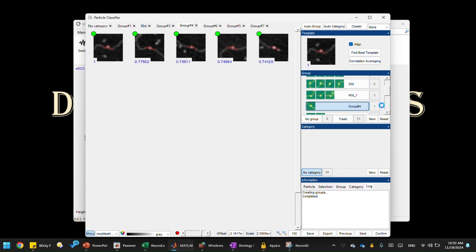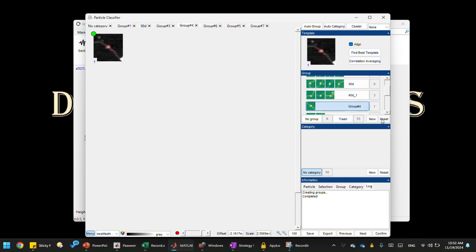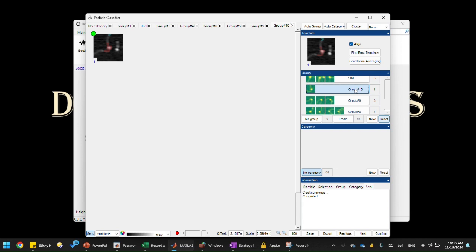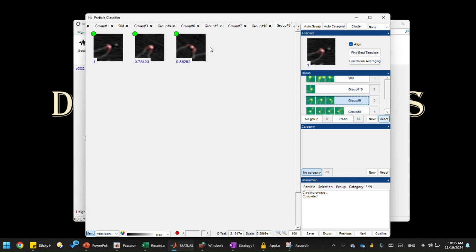Group 4 we already did as unbent state. We can rename that as 0 degree. And group 6, yeah, we already did that, right? So it's 0 degree. We can't rename them the same way, so I need to vary the name a little bit. Now group 10, I think it's the one that we throw out. Yeah, this is a false positive one. That should be 0 degree. So that's group 9. This is a highly bent state. That's 135 degree. But this one is a false positive. This belongs to 0 degree. I think it belongs to group 10.